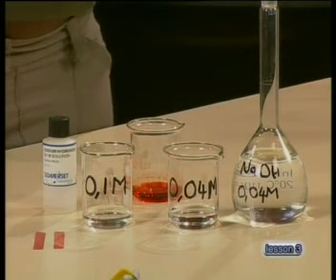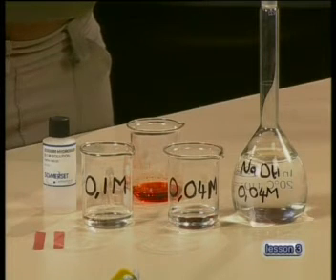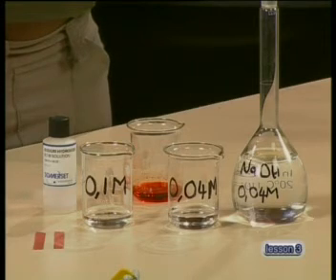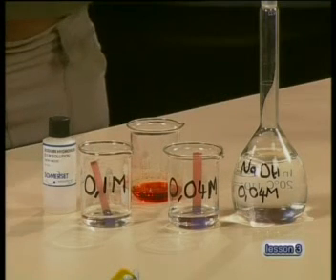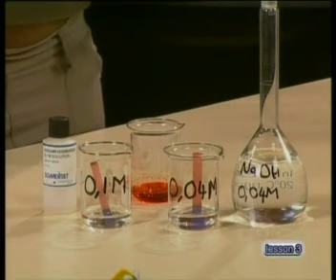Even though both these solutions are diluted, they are still both solutions of a strong base. By diluting the alkali, there is a difference between the samples. But when I test them, I notice that they both turn pink litmus blue. There must be a better way to indicate how basic or acidic solutions are — we will need a better indicator to show us this difference.